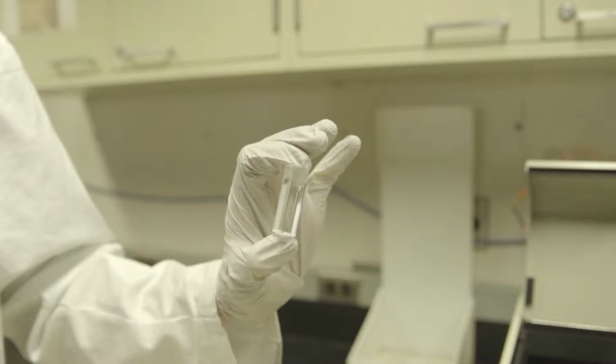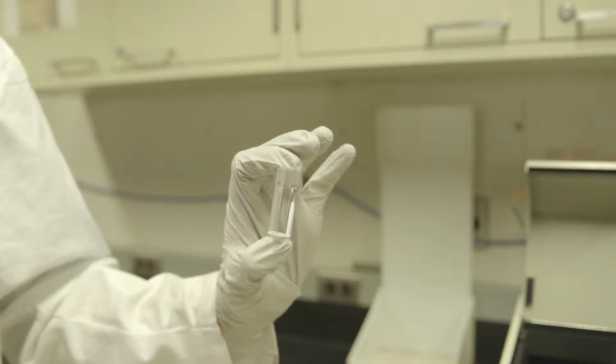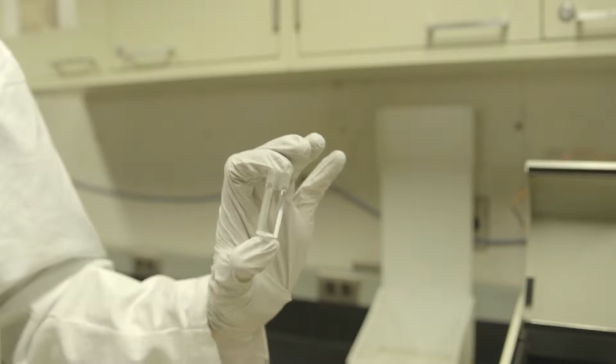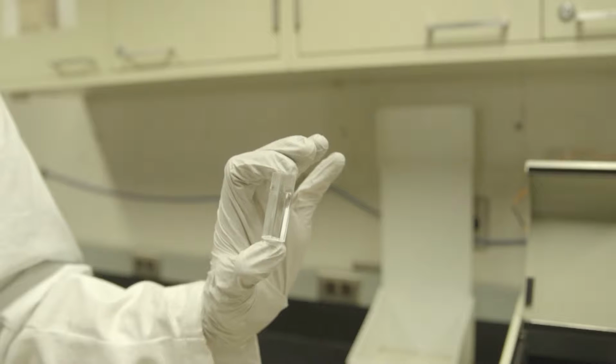While handling the cuvette, you should try to avoid touching the sides, and you should wipe it down with a chem wipe if you get anything on them or do touch the sides. Additionally, when you're loading the cuvette into the device, you should make sure to do it the same way each time, as this will prevent impurities in the cuvette from inconsistently affecting your measurements.